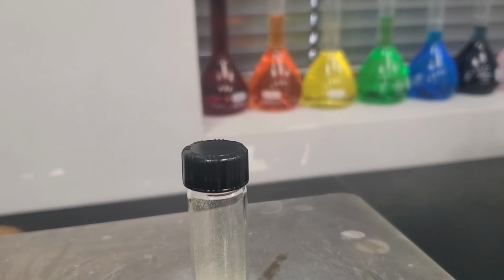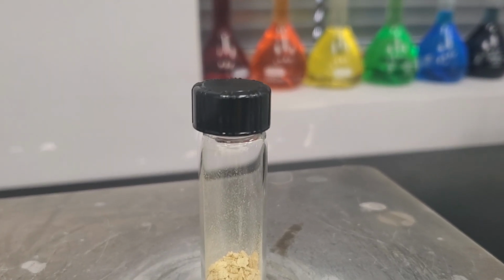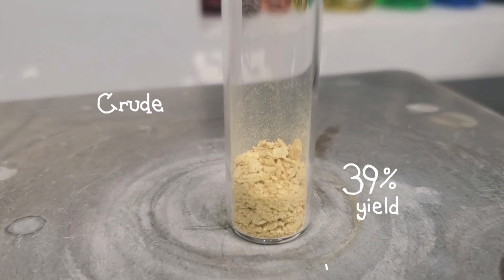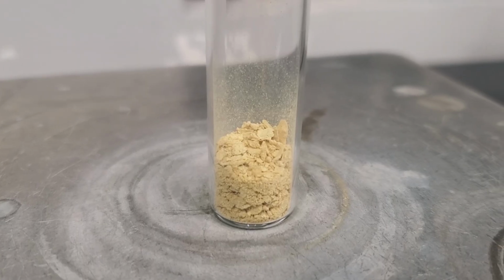From the crude isolate, I obtained a 39% yield. That's lower than ideal, but still enough to show product formation and move on to purification.